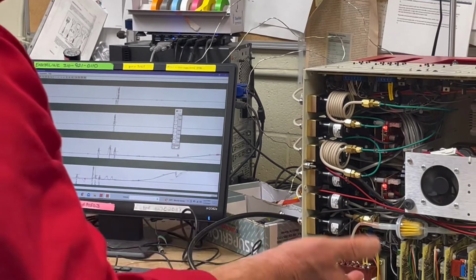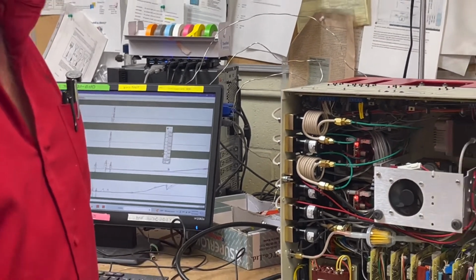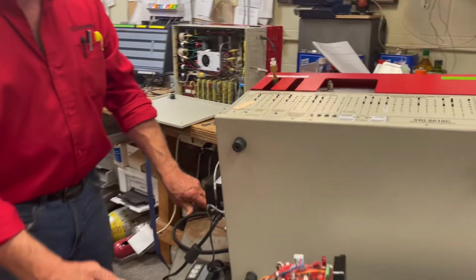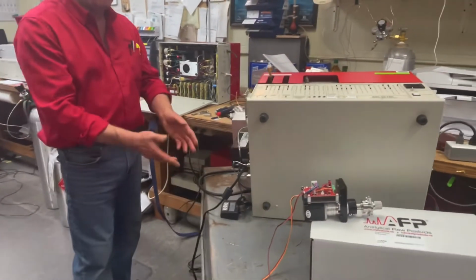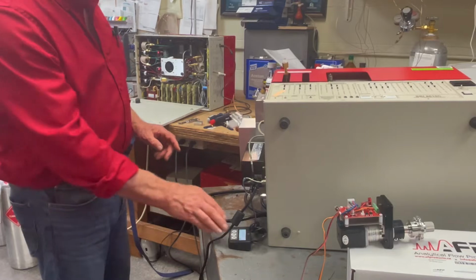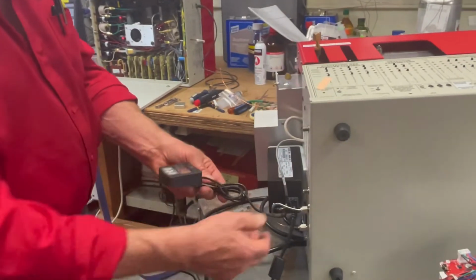Okay, so it goes this way and that way, and that's the kind of sound that these valves make. Now there's another kind of valve that is essentially very similar, but it's made by a different company called Valco, and it looks like this. Usually we use the Valco because it's got some advantage, and sometimes we use the AFP because it's got some advantage. So the way the Valco works is it's got this little brain box that's plugged in, right?